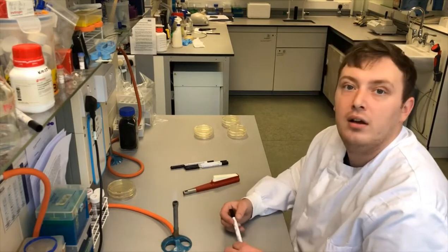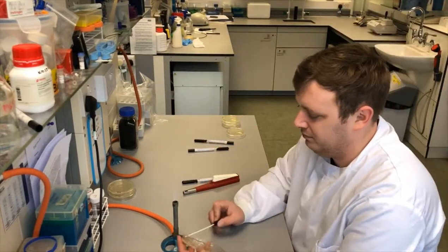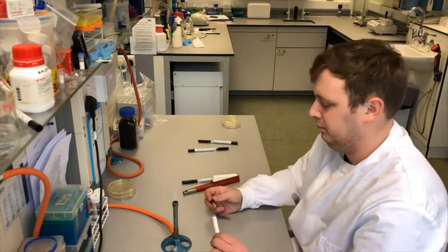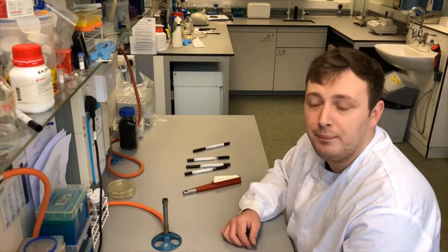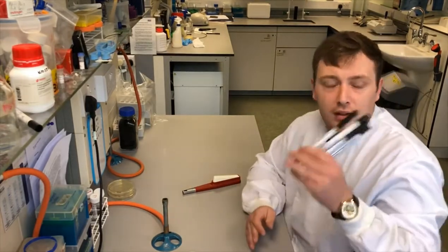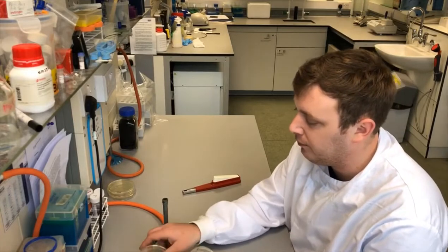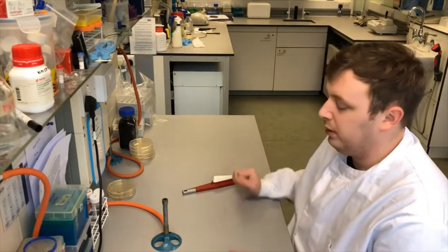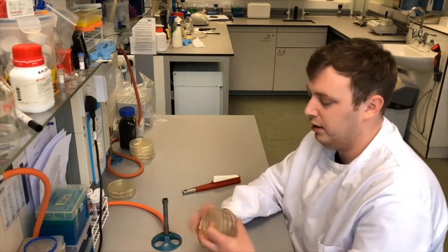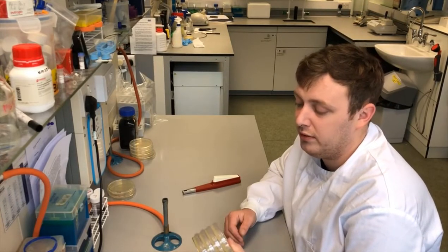So that's one set done. Now we've swabbed all of them, the swabs will be disposed of. We're going to separate them out — the 20-degree samples are left out on the bench so we'll see what's surviving at room temperature, and the others go into the 37-degree incubator to show what's growing at body temperature. In the next clip, I'll show you the results.